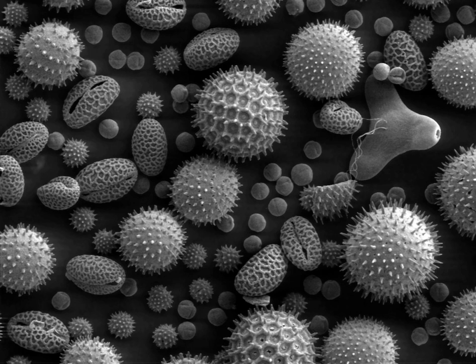SEM samples are prepared to withstand the vacuum conditions and the high energy beam of electrons, and have to be small enough to fit on the specimen stage. Samples are generally mounted rigidly to a specimen holder or stub using a conductive adhesive. SEM is used extensively for defect analysis of semiconductor wafers, and manufacturers make instruments that can examine any part of a 300 mm semiconductor wafer. Many instruments have chambers that can tilt an object of that size to 45 degrees and provide continuous 360 degree rotation. Nonconductive specimens collect charge when scanned by the electron beam, and especially in secondary electron imaging mode, this causes scanning faults and other image artifacts.